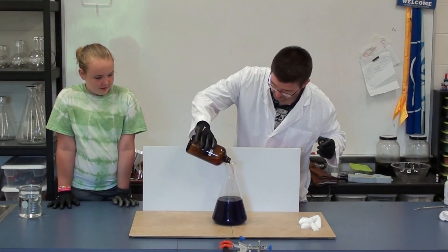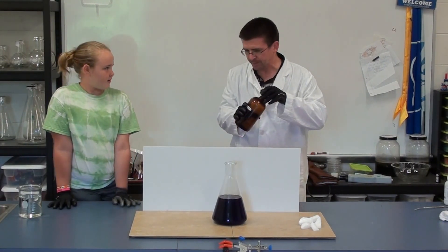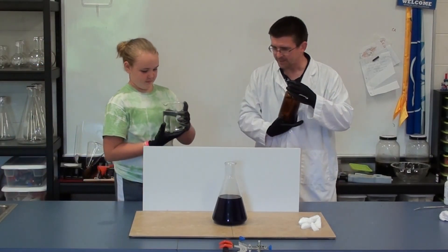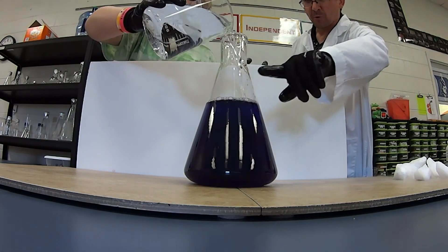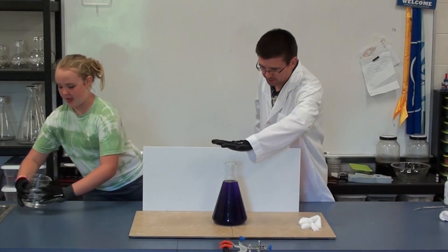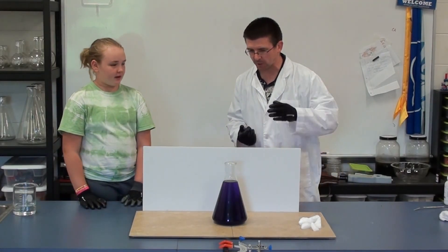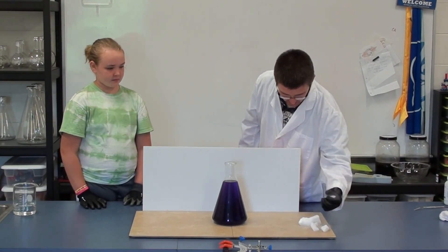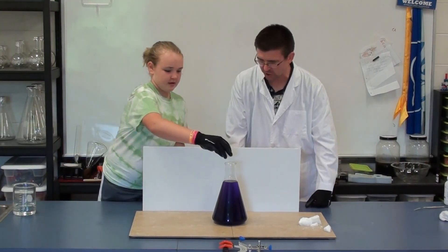I'm going to add a little bit more of this — let's go ahead and empty the bottle in there, and I'll have you take that beaker of water and fill us up to about three inches from the top. So basically water, universal indicator, and a tiny bit of sodium hydroxide just to give it an alkaline pH. Now we're going to take a couple of these little pieces of dry ice and just drop them into our indicator solution and see if anything changes.